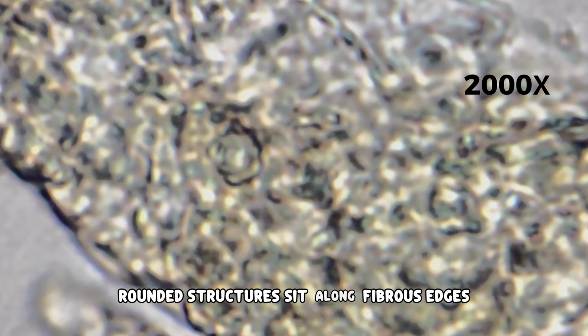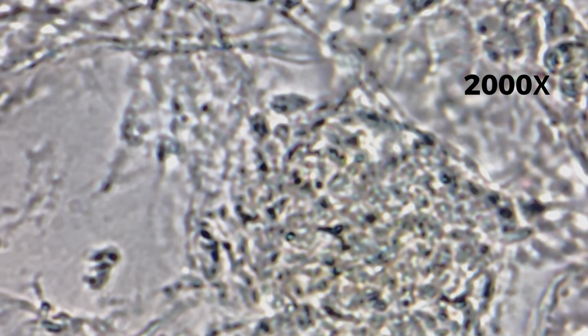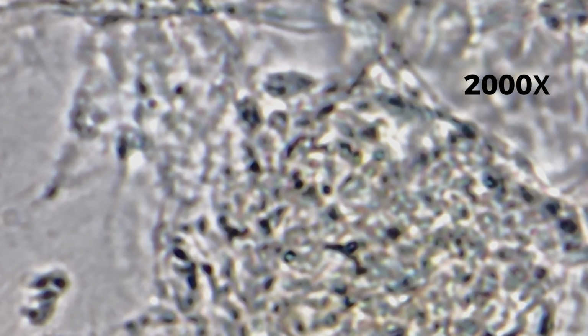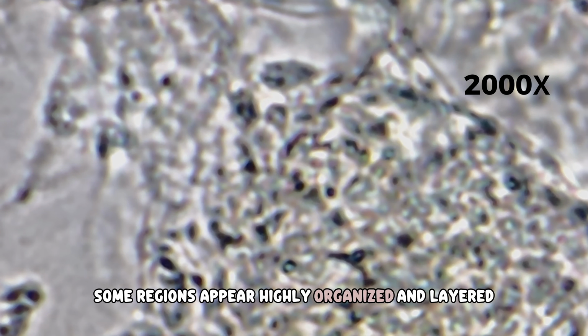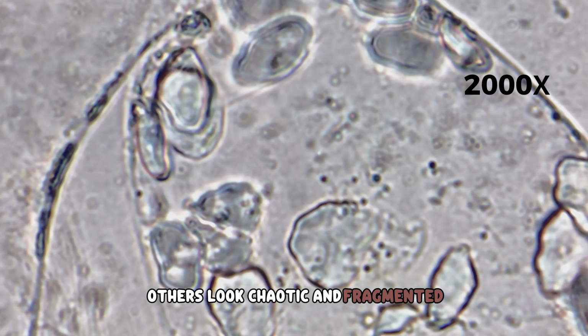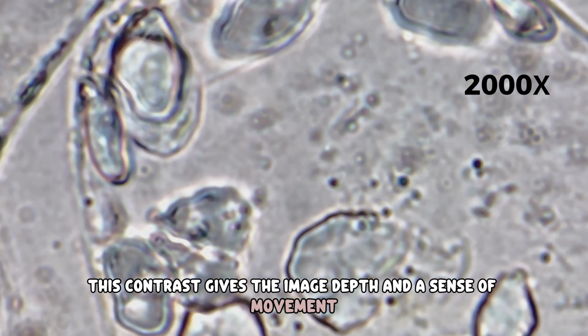Rounded structures sit along fibrous edges. They follow contours and repeat across the image. This repetition forms subtle patterns throughout the field of view. Some regions appear highly organized and layered. Others look chaotic and fragmented. This contrast gives the image depth and a sense of movement.